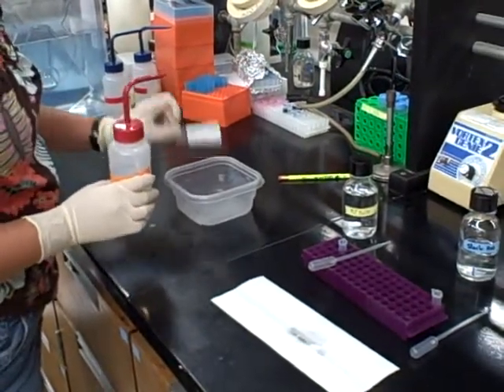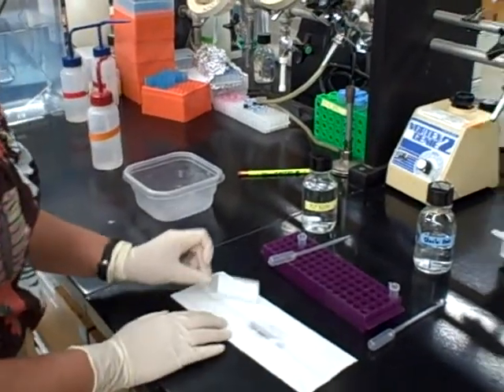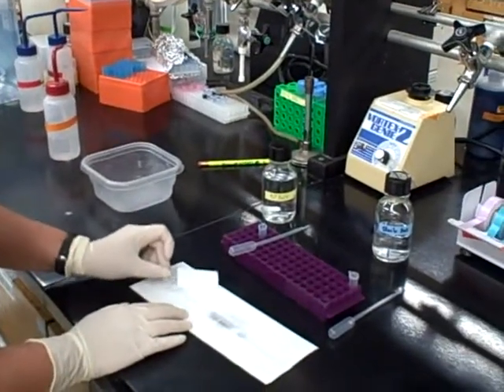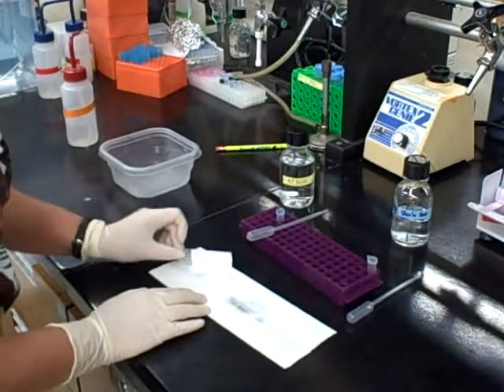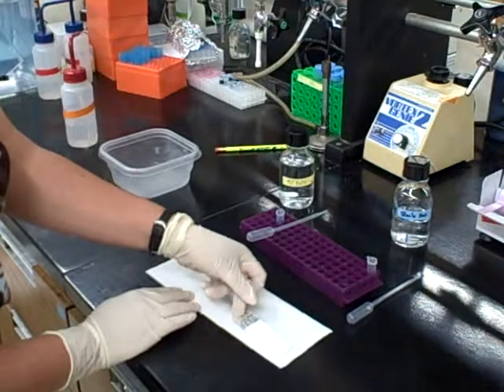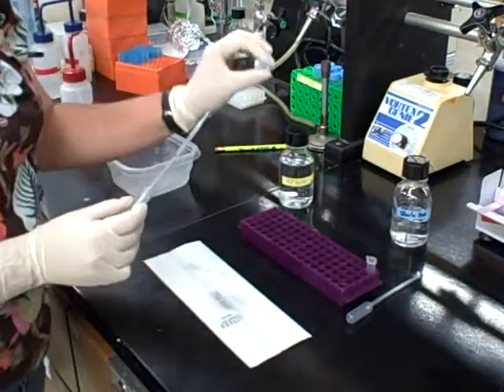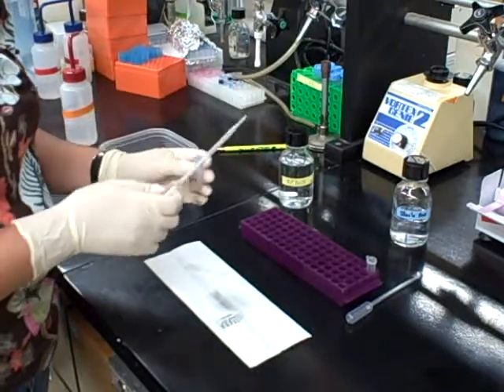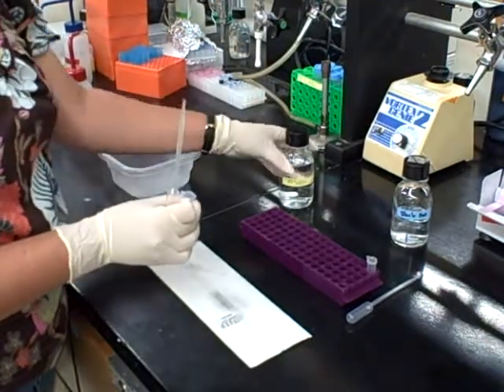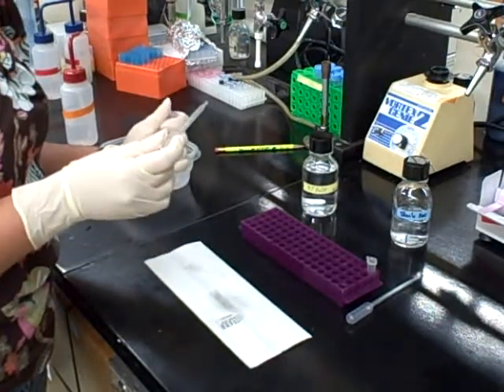You would let that sit for five minutes, and then the cDNA is washed off with microarray wash solution. The wash solution is also just water. Now theoretically the cDNA has hybridized to the DNA on the slide, and now we add the color reagent that will allow us to see which cDNA samples actually adhered or hybridized to the DNA on the slide.